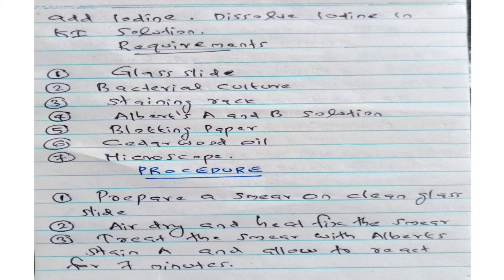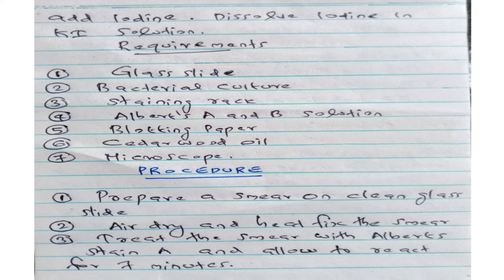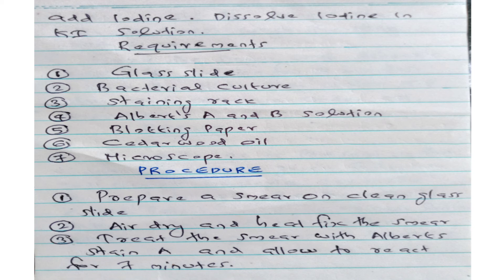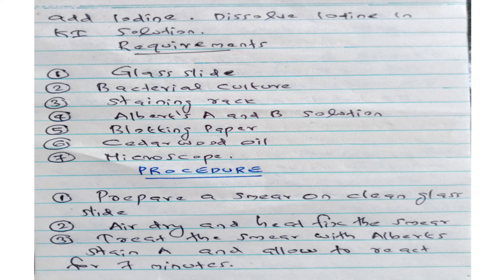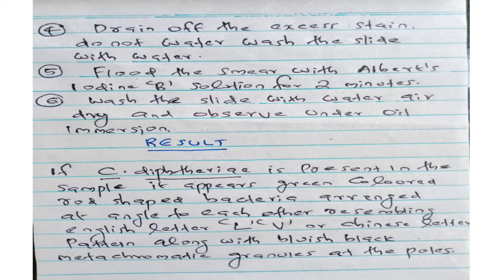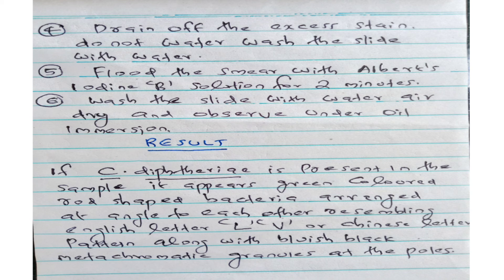What is the procedure of Albert staining? Prepare a thin smear on a clean glass slide. Air dry and heat fix the smear. Treat the smear with Albert stain A and allow to react for 7 minutes. Drain off excess stain using blotting paper. Do not wash the slide with water.